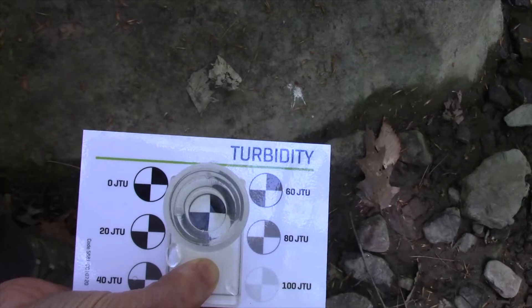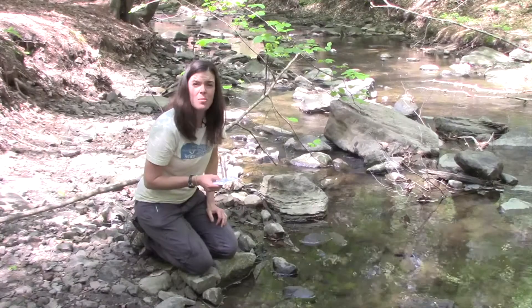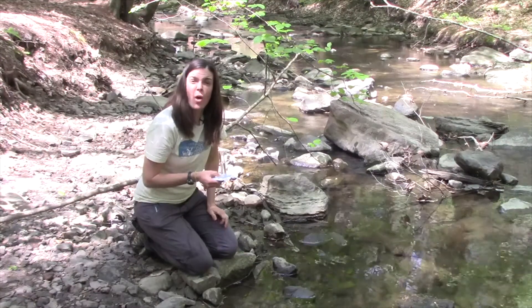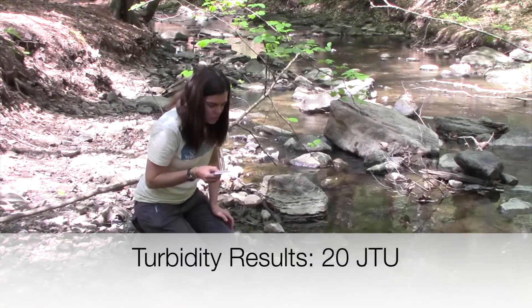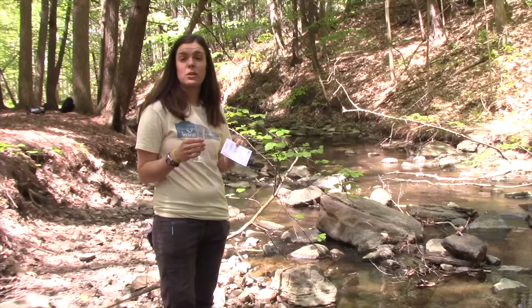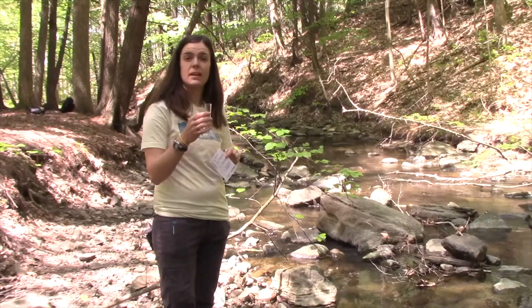By looking down this turbidity tube, I can see that it's close to the 0 to 20 JTU marking. Lower numbers are better in this case — they mean the water is more clear, as in a higher level of clarity. With a reading between 0 and 20, we're looking pretty good on this stream. Record the data on your sheet, and there's no need to keep this water anymore, so you can toss it right back in the stream.